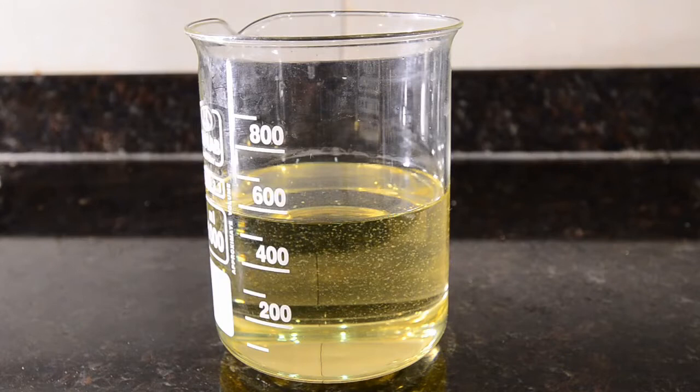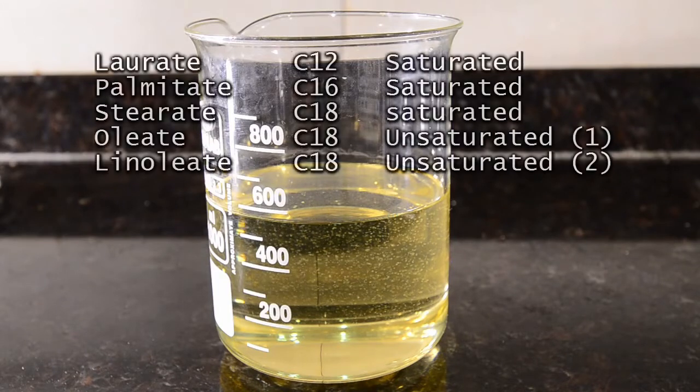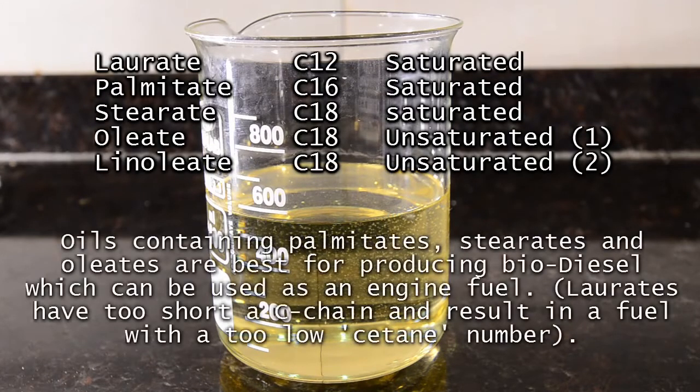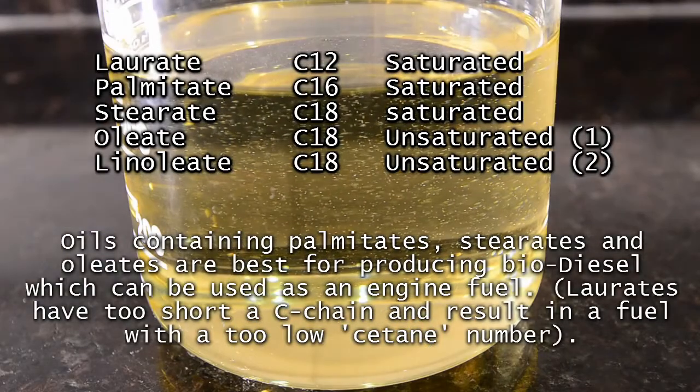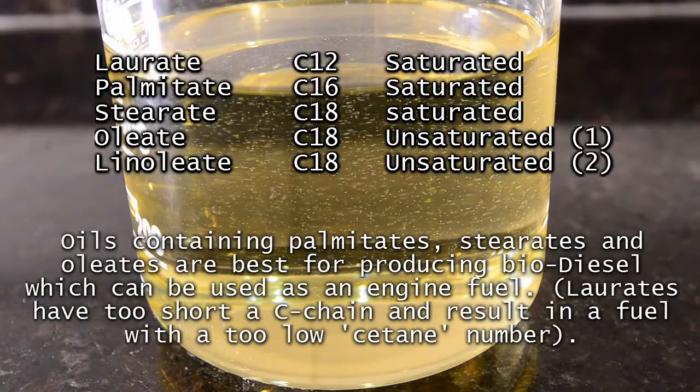To get a useful fuel you need to use a starting oil which contains fatty acids containing 16 carbons or more, and which are relatively saturated or only contain one double bond.